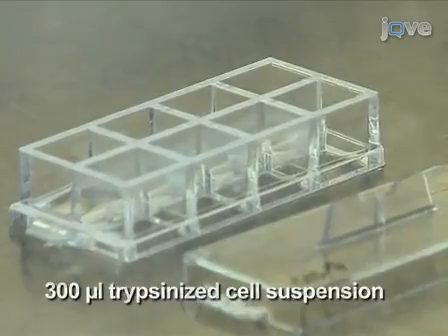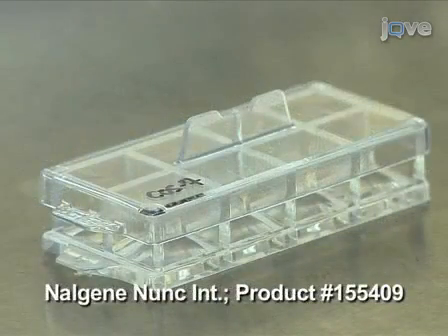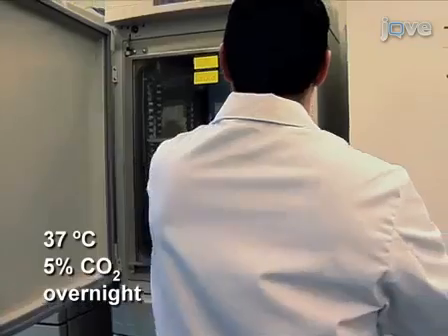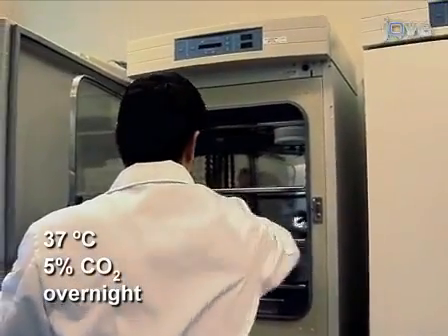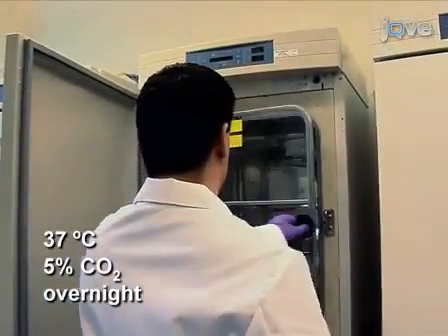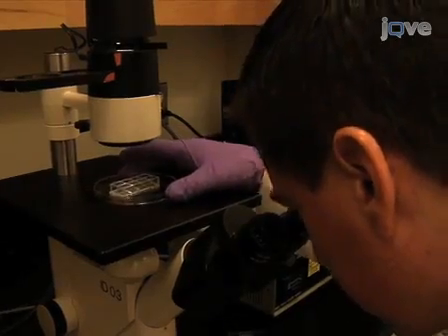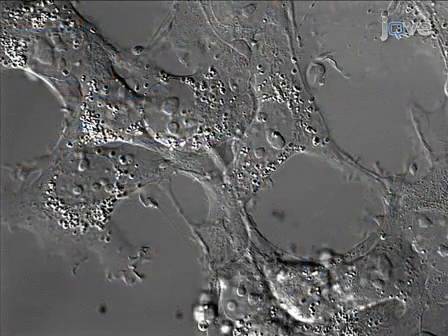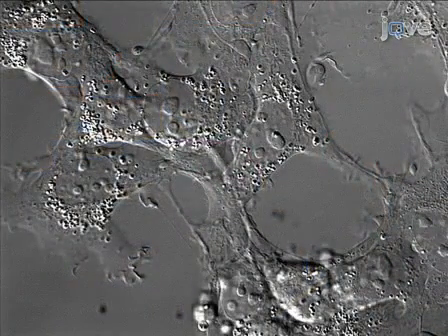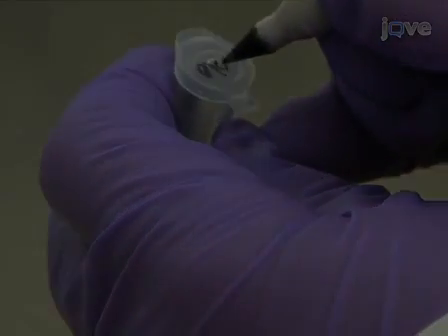Add the aliquots to a sterile eight-chamber Lab-Tek chambered cover glass. Incubate samples at 37 degrees Celsius with 5% carbon dioxide overnight. On the following day, check the cell culture chambers for cell density and health, and label the appropriate number of microfuge tubes.